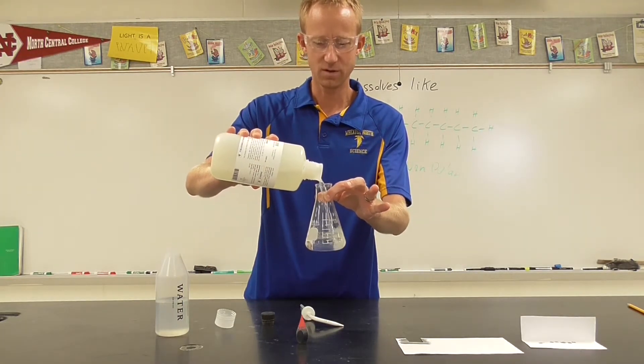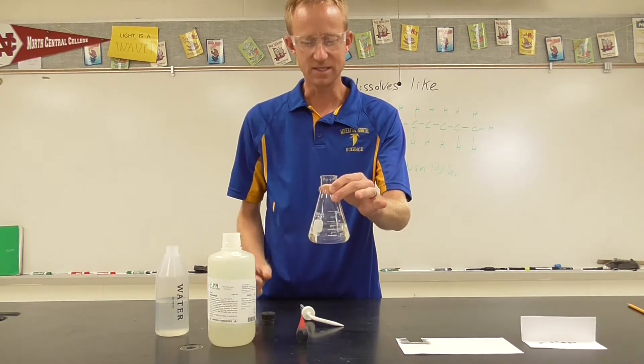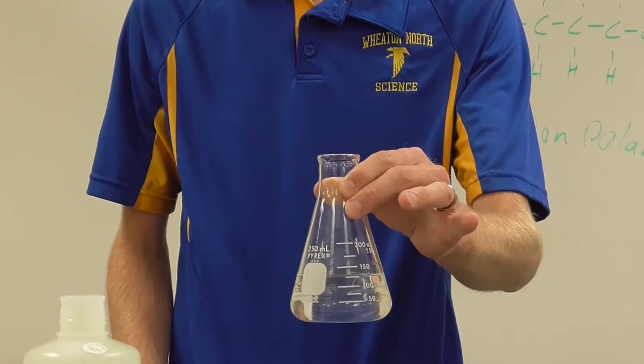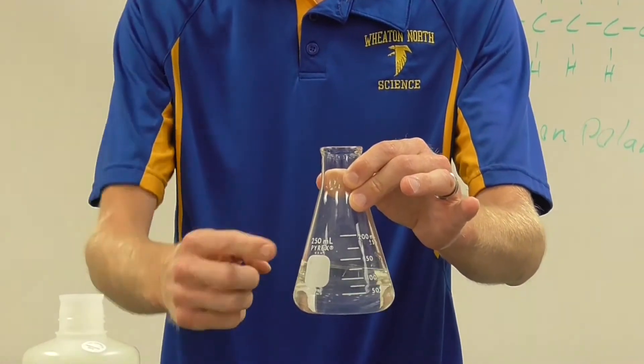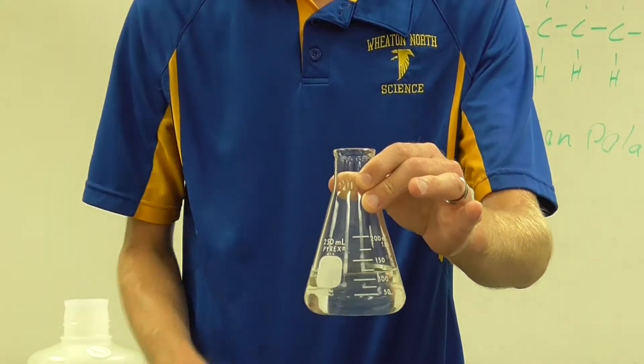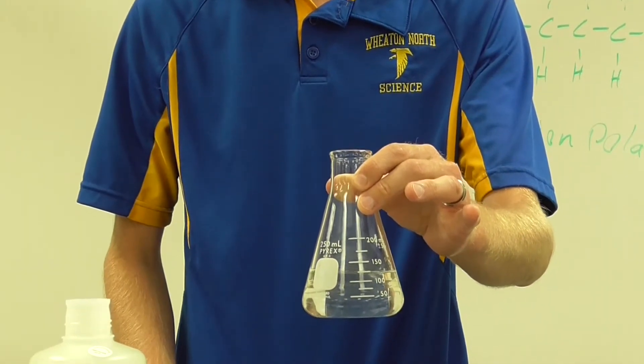And these are not similar. So what you'll see is these are immiscible, meaning they do not dissolve in one another. We have hexane, which is the less dense layer on top, and we have water, which is the more dense fluid on the bottom.